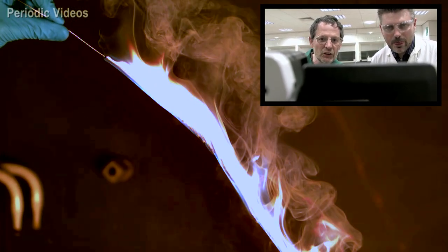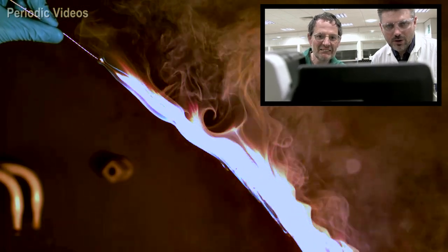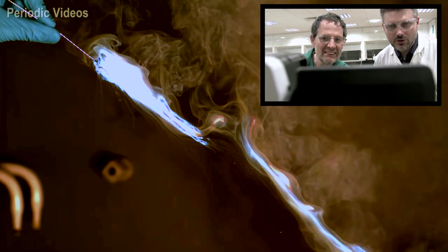You see when the oxygen exposure to the droplets is maximized, the blue color is maximized. And my guess is as we see more and more material, it'll look whiter and whiter, which it does. And of course you see blue right on the edges.